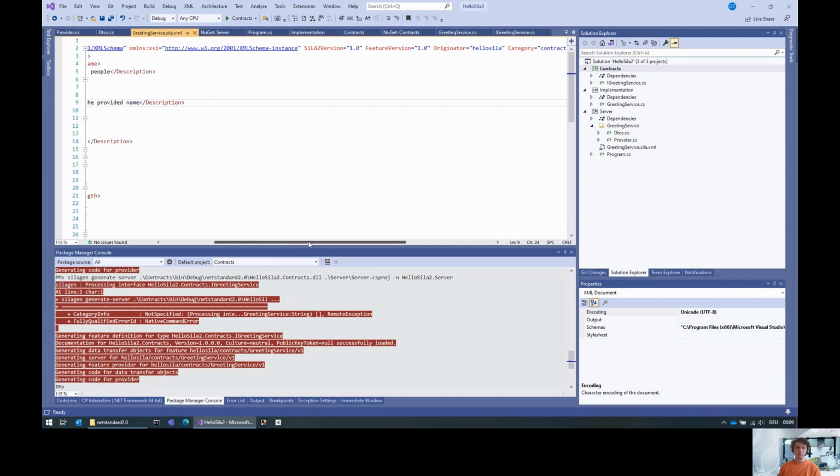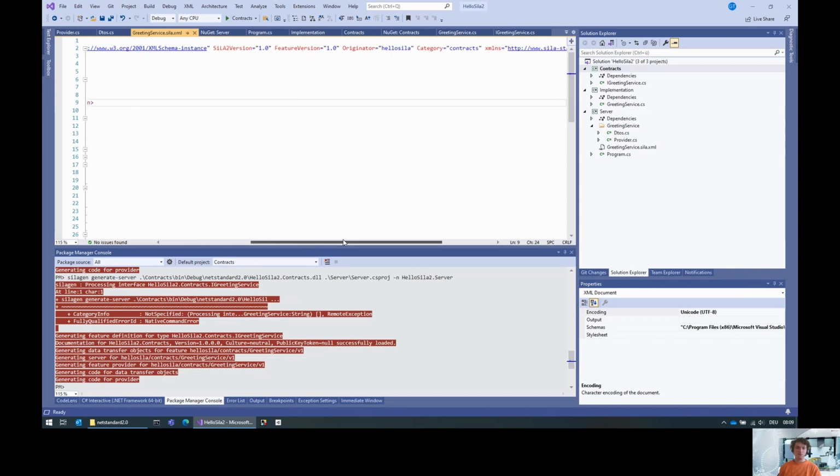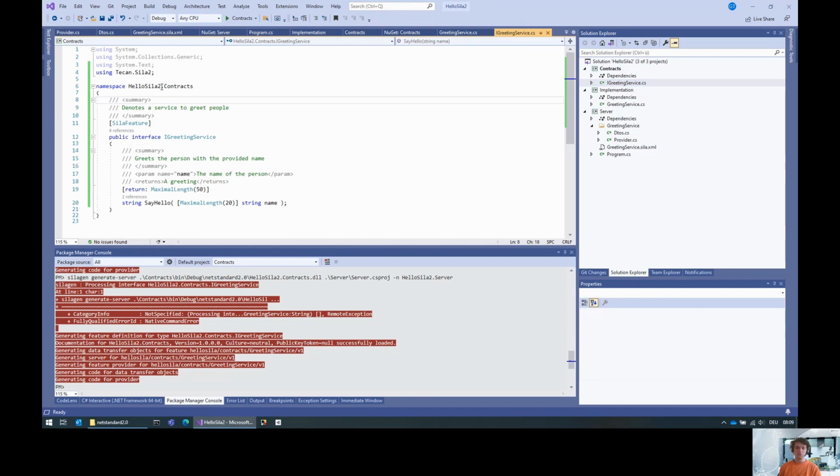Now you notice that if you look into the feature on the top, you have a feature version 1.0. That is because the assembly version of the contracts is 1.0. And we have the originator, hello SiLA, and category contracts. Those are basically derived from the namespace, because this is hello SiLA2.contracts.